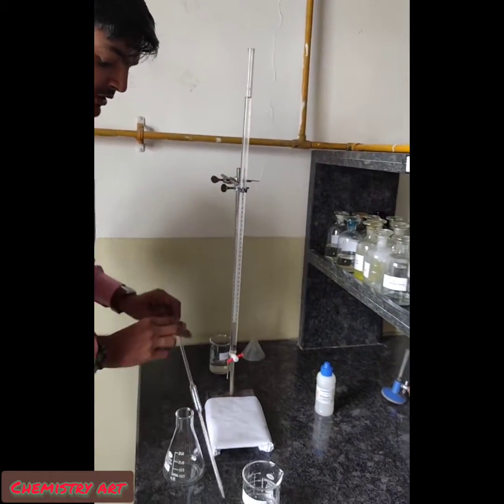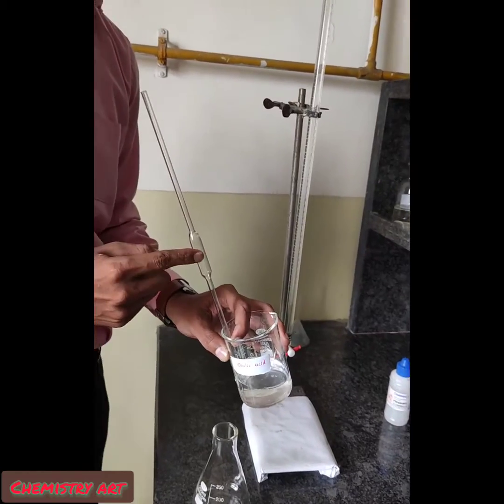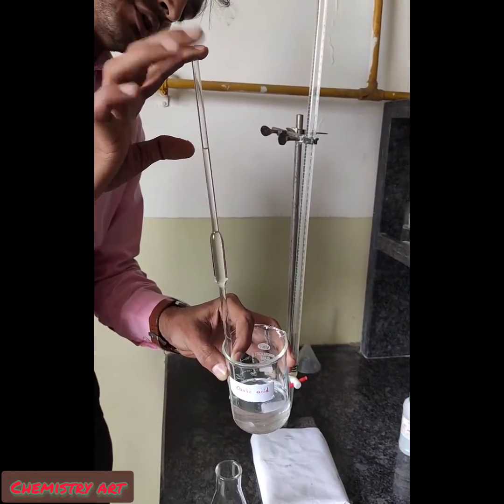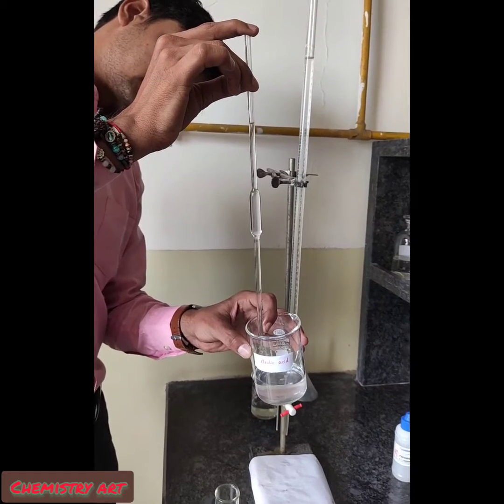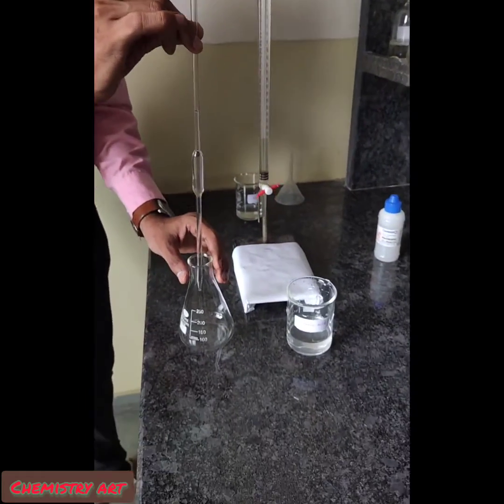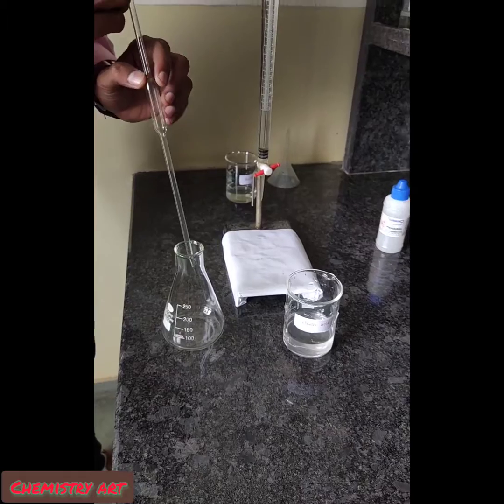Now take 10 ml of the oxalic acid solution using a 10 ml pipette. Suck the solution above the marking, then slowly release the pressure of your finger so the solution starts dropping, and apply pressure again when the solution reaches the marking. Here it is exactly 10 ml. Add it immediately into the conical flask.